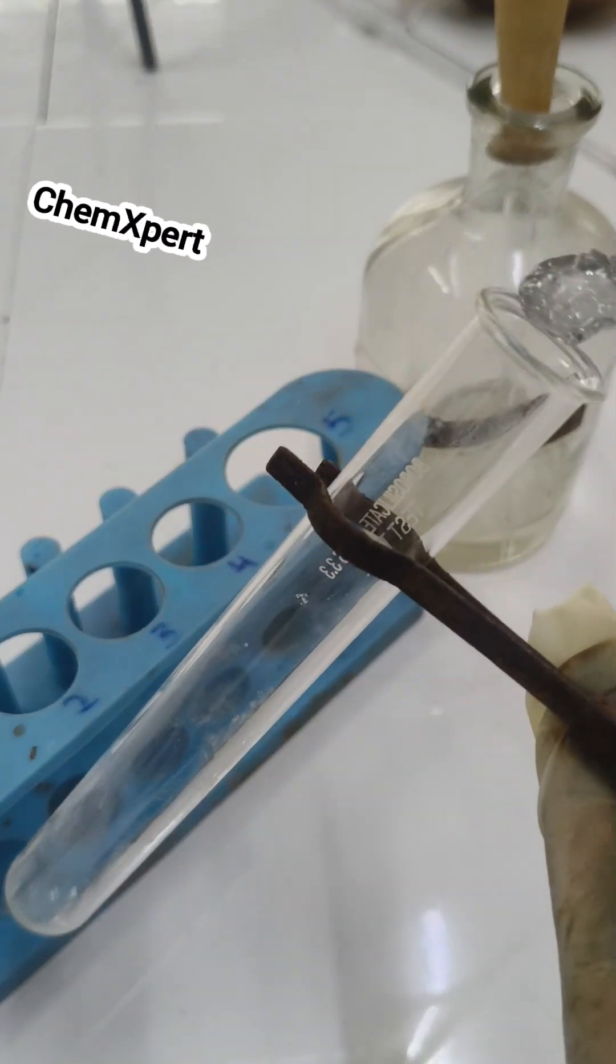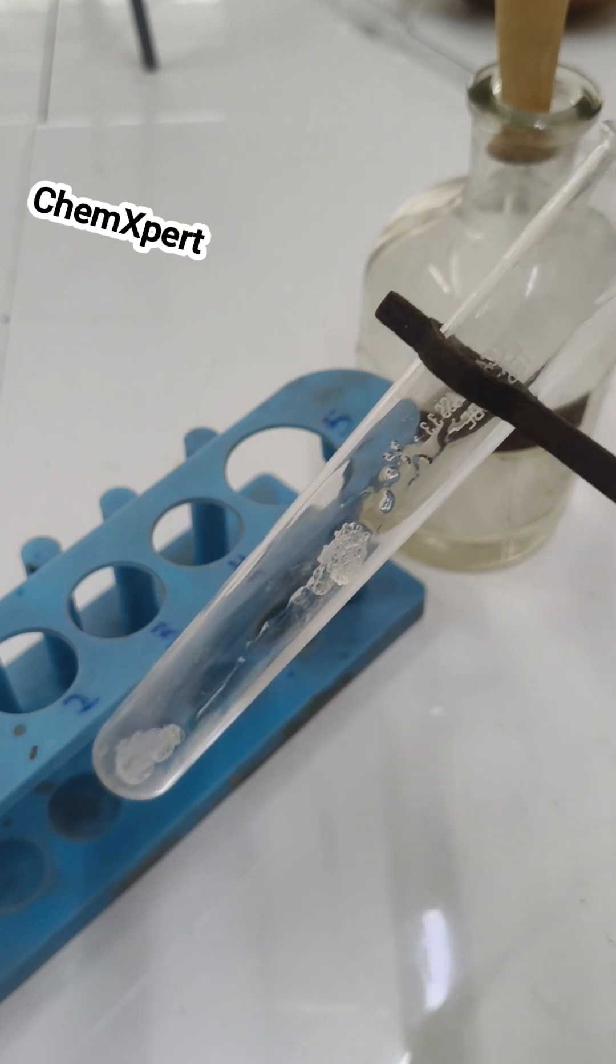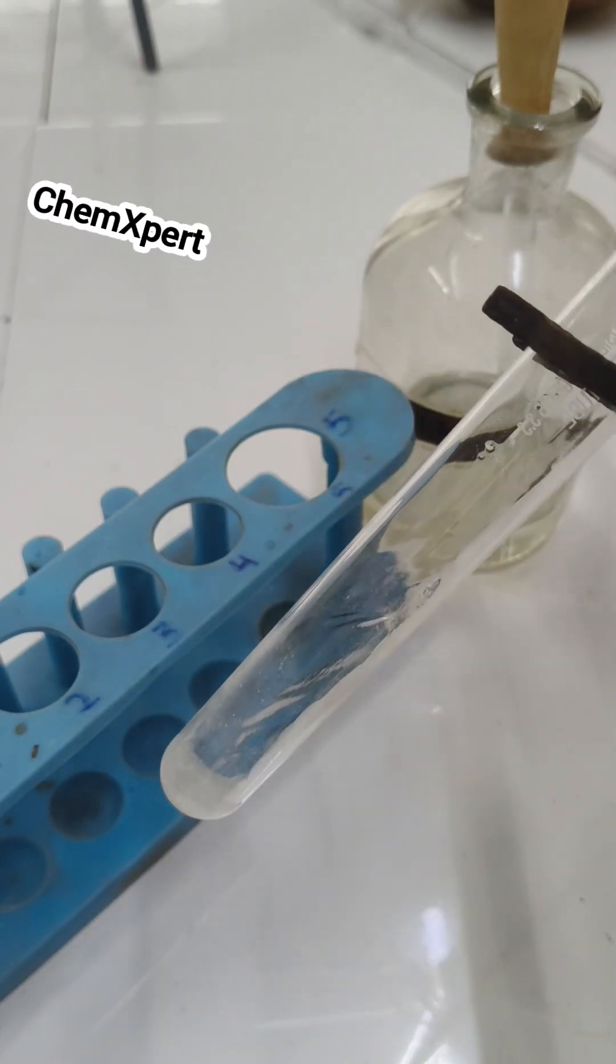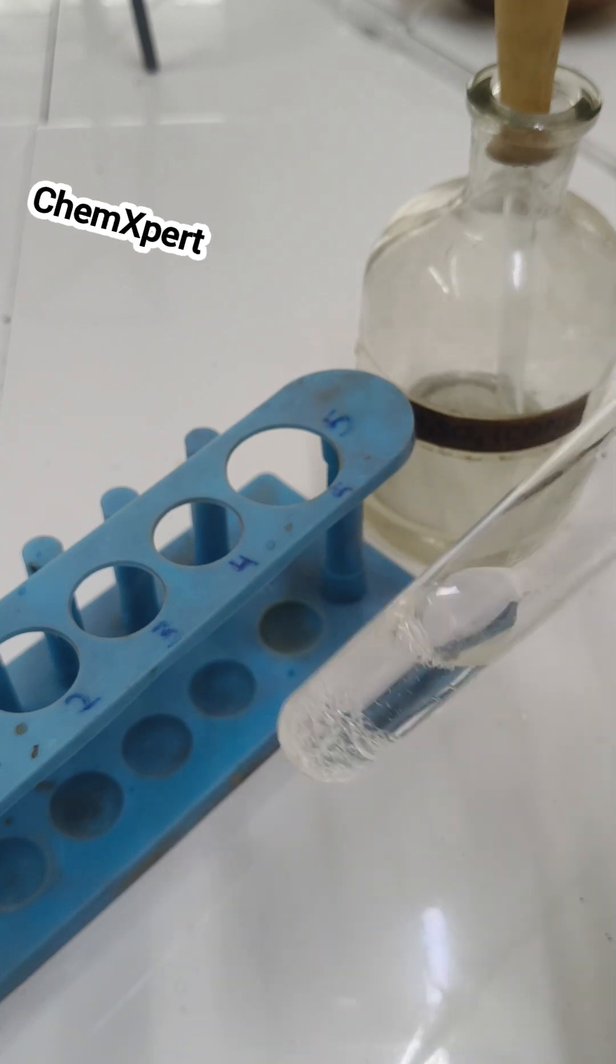Take a solid salt and prepare the aqueous solution of this salt. I have taken some crystals in a test tube and then add distilled water into it to prepare its aqueous solution.